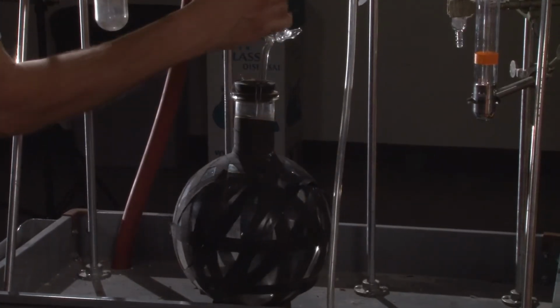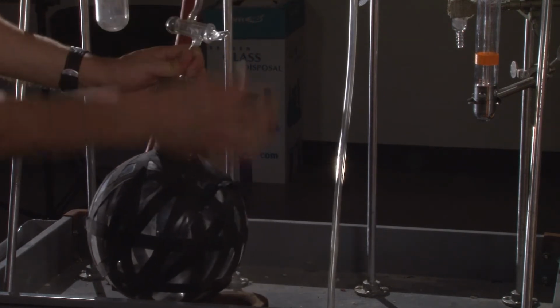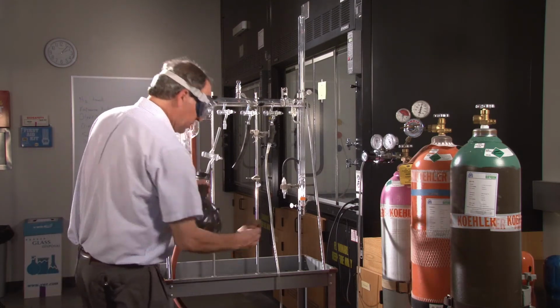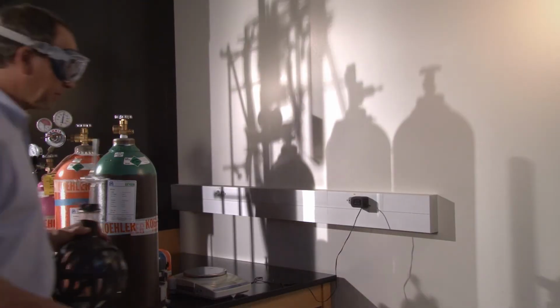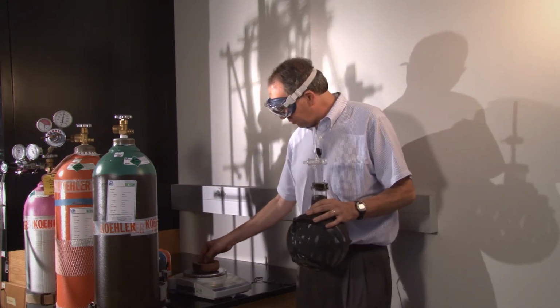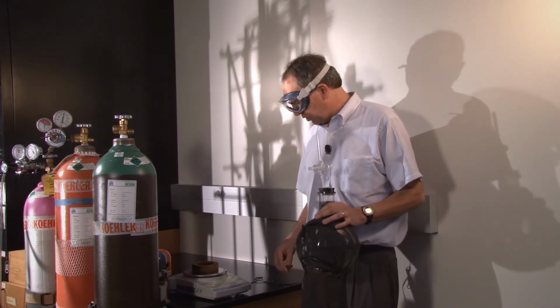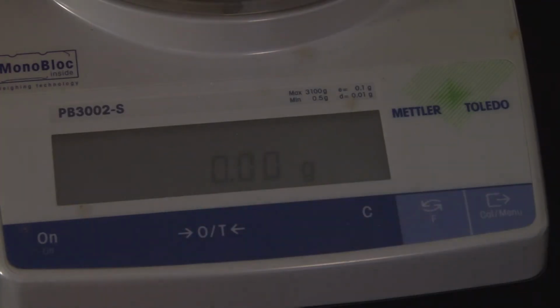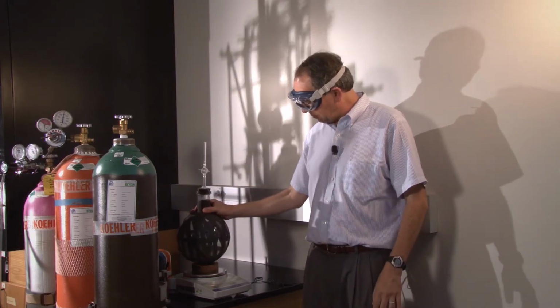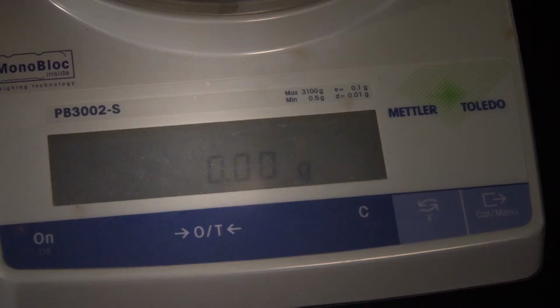All right. We're just going to gently pull this glass tube off of there, and we need this cork ring in order to do this. We're going to weigh the sample. The first thing we do is we put the cork ring on here, and we're going to zero the scale. And now we're going to put the sample with the CO2 on it onto the scale.